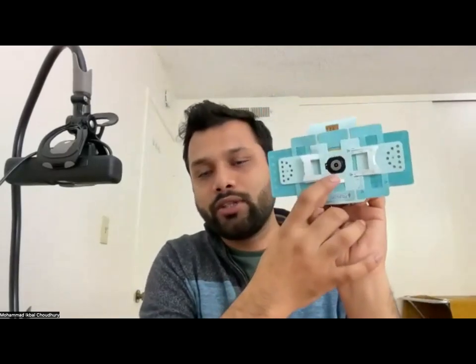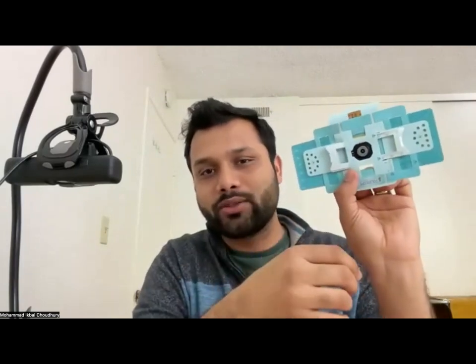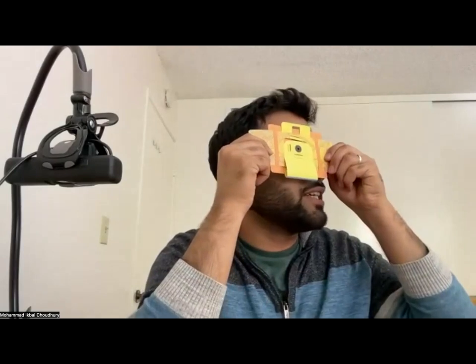Now, we'll talk about how to connect your phone to this foldscope and how to take good pictures with it. But for the time being, if you are in the field, you made a sample, you wanted to take a quick look, that's how you would do it. Just take a quick look. Okay, it's very straightforward, nothing fancy here.